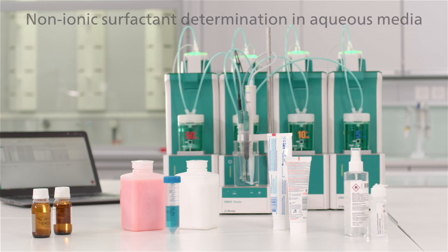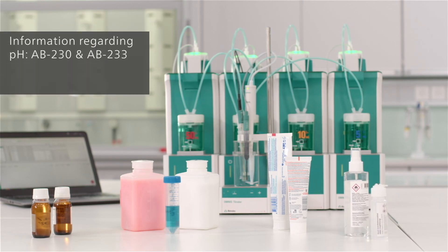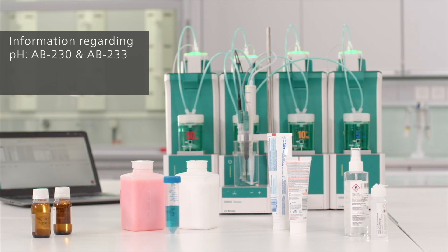The nature of the surfactant defines the pH at which the titration is performed. The principle behind the aqueous surfactant titration is a precipitation titration.